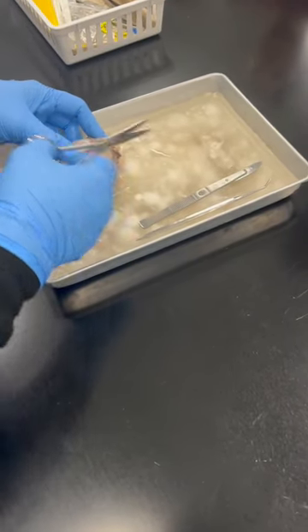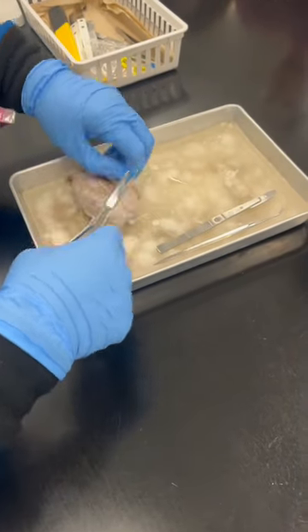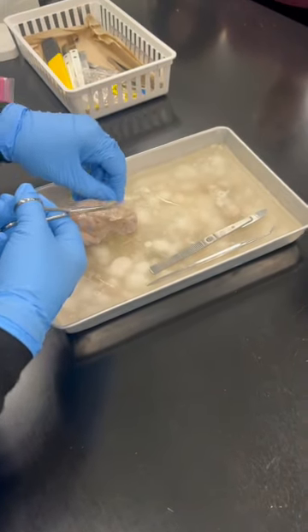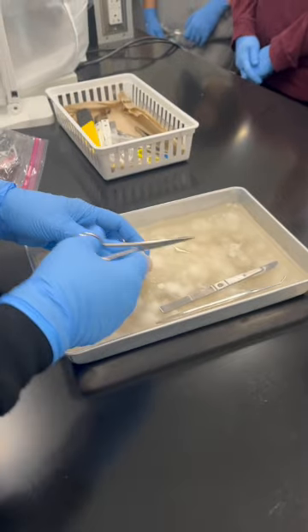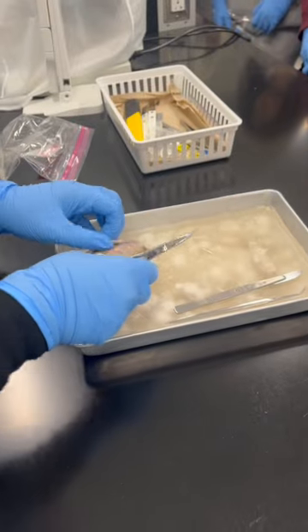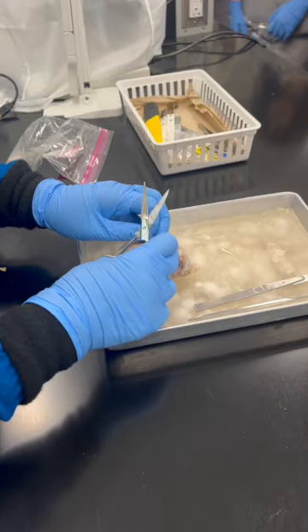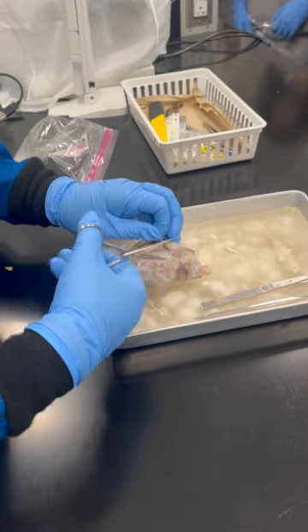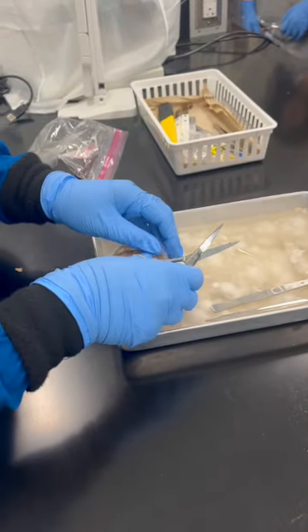It's very tough in some areas, especially coming towards the back. It's going to be tough. That's very important because sheep graze and walk around. You don't want too much pressure given by, do you know what this portion of the brain is? Cerebrum or cerebellum?